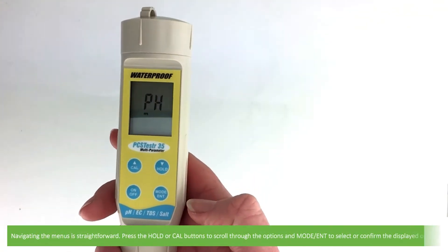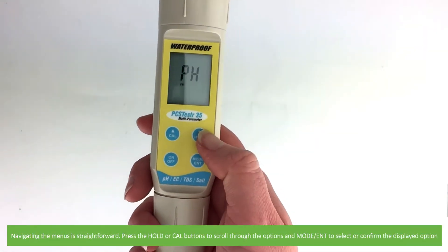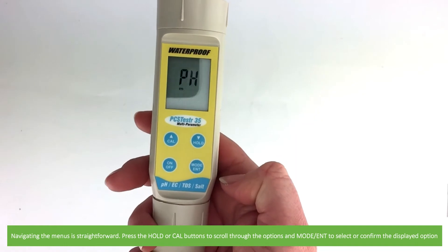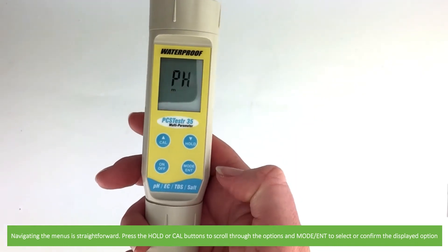Navigating the menus is straightforward. Press the hold or cal buttons to scroll through options, and the mode enter button to select or confirm the displayed option.